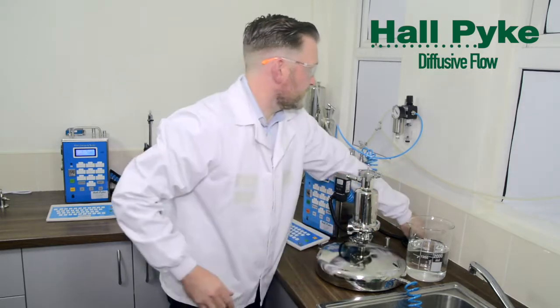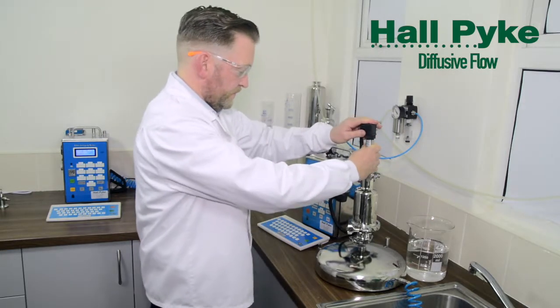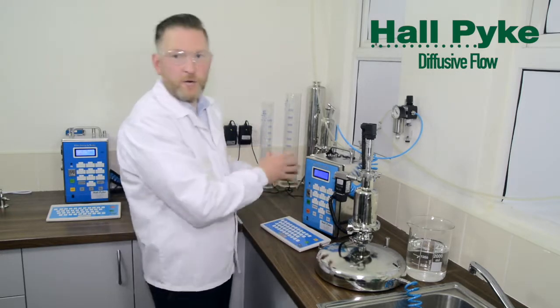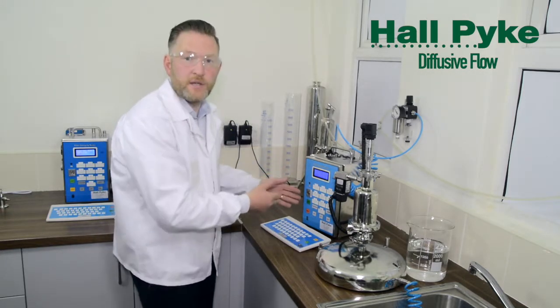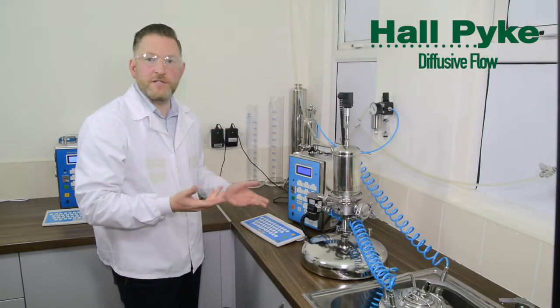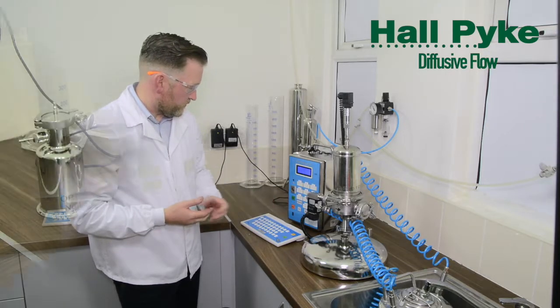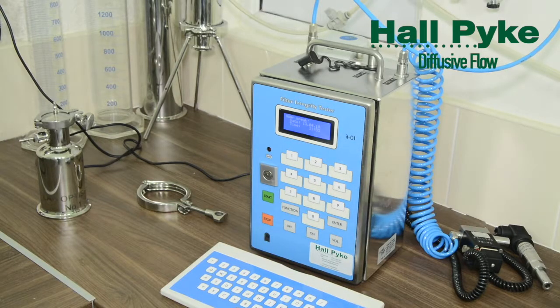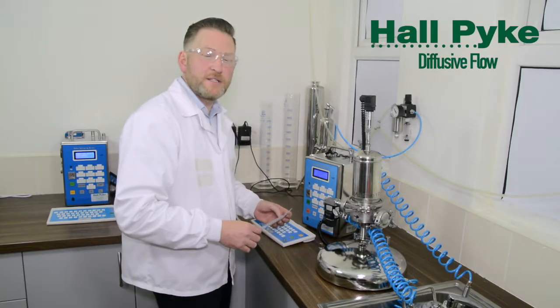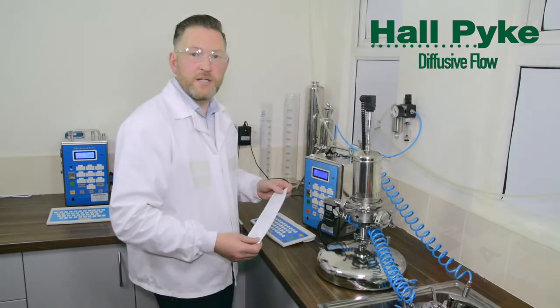Attach our filling valve and our pressure sensor. The probe has already been preloaded onto the tester and is now ready to go. It's now just a matter of starting the test. The test takes 20 minutes, and at the end a result is printed stating whether the filter has passed or not.